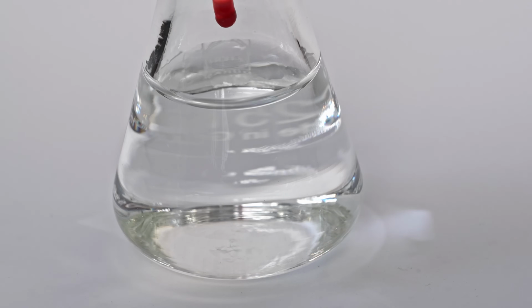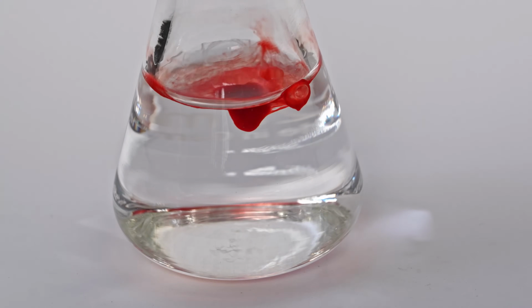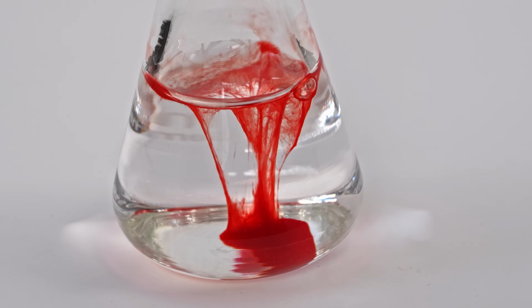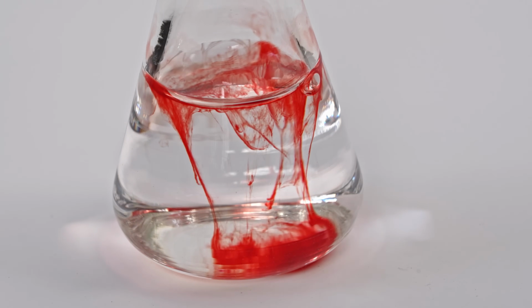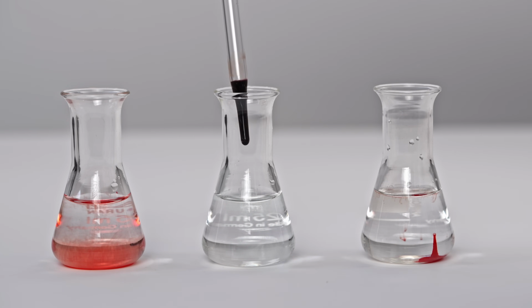I'm not sure, but perhaps this behavior of the blood is caused by the alkaline reaction of potassium cyanide solution and not by the cyanide itself. Unfortunately, I didn't do a separate experiment with alkali for comparison. And these are 3 drops of black blood after hydrogen sulfide.